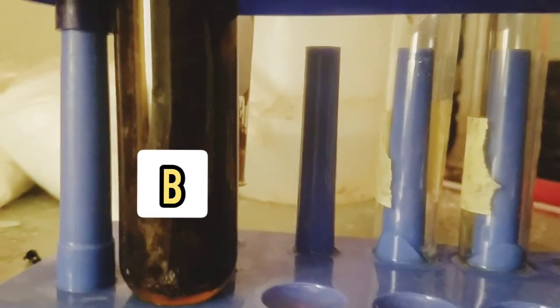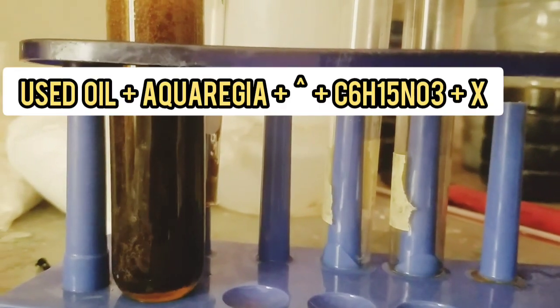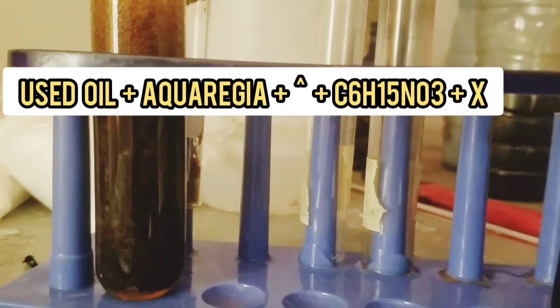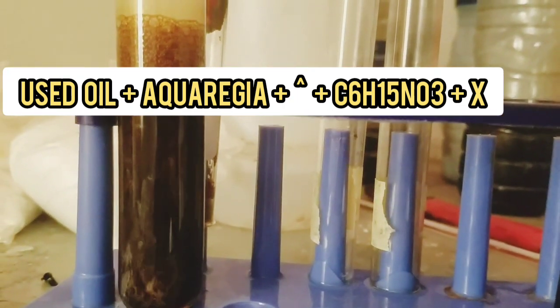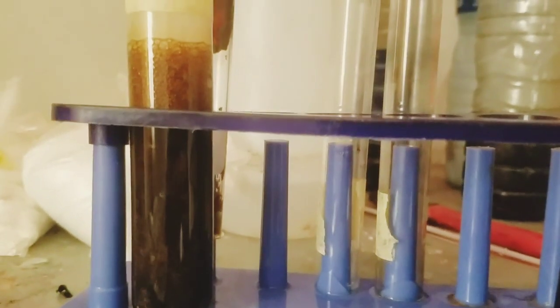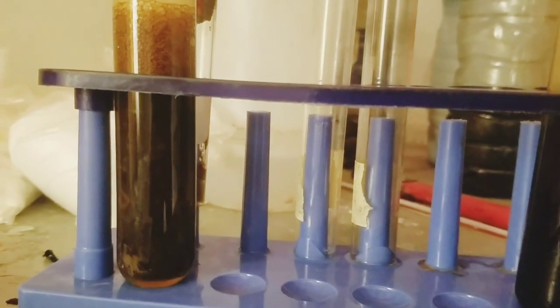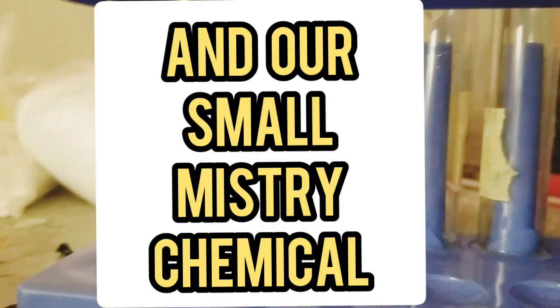It's not as reactive. It's just there. I don't know, it may be reacting, but it's on a very micro scale. It's not very visible. Then B is a mixture of aqua regia and the clouded, that is the used oil, plus a few drops of triethanolamine. And then this is the visible reaction you can see going on.